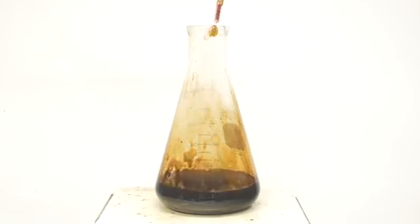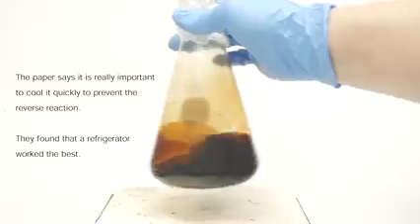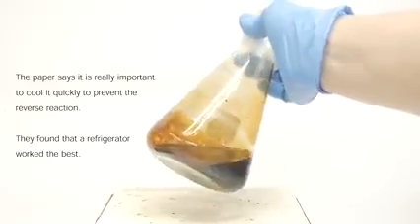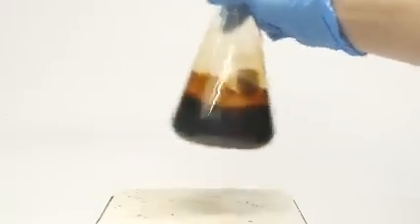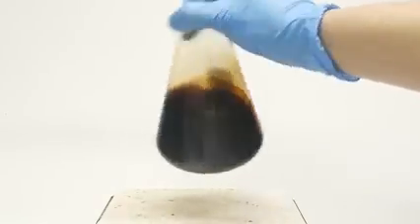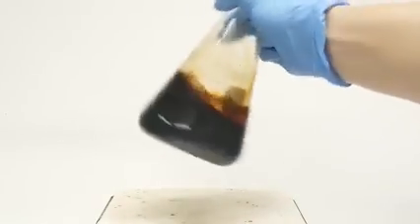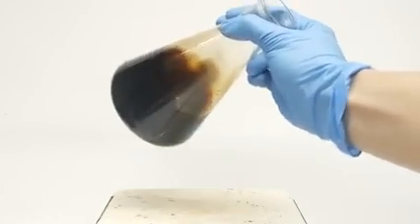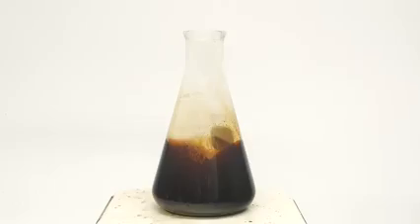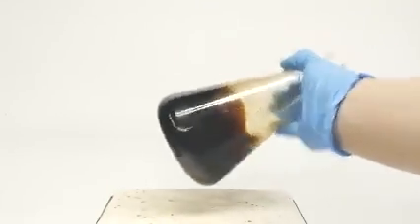The moment it finishes, I take out the thermometer and I cover the top with some plastic wrap. The entire flask is then placed into a fridge for a couple hours. A few hours later, I pull it out, and I have this brown goopy liquid. This was really promising for me because I started out with fatty acids that were solid at room temperature, but now I have a liquid even at refrigerator temperatures. So at the very least, some sort of chemical reaction has occurred.